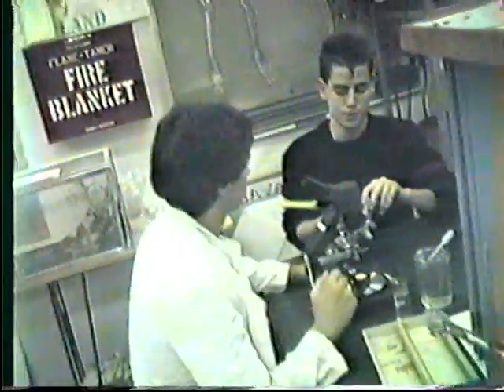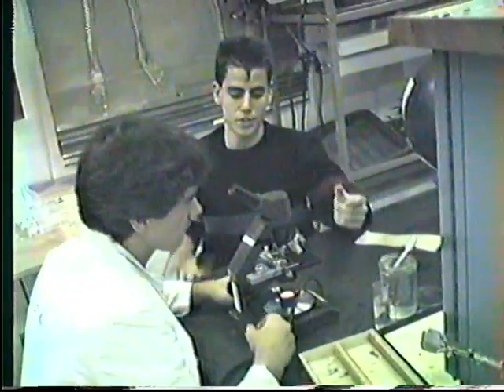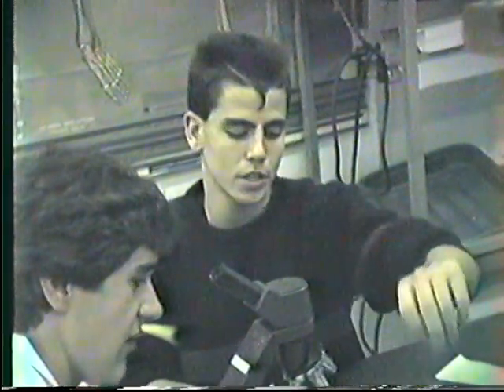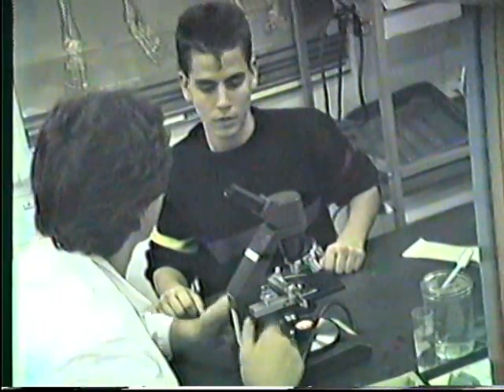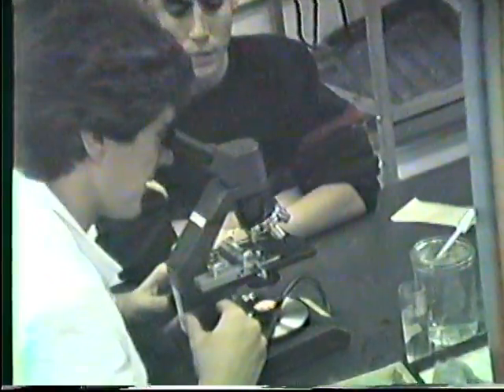What we're doing here is comparing the deep water sample with a shore sample. Find a difference in the organisms that live on the shore and in the deep water. And there's already a temperature difference, so you know there's going to be a difference in what kind of organisms live where in the pond. Transparency compared to deep water. I'm going to compare to this one. Give me time to do it. You want to look at it?